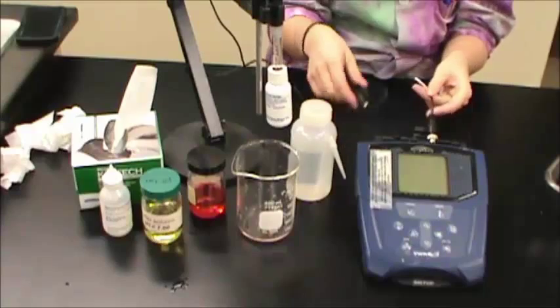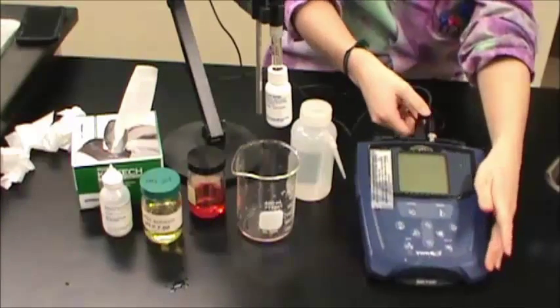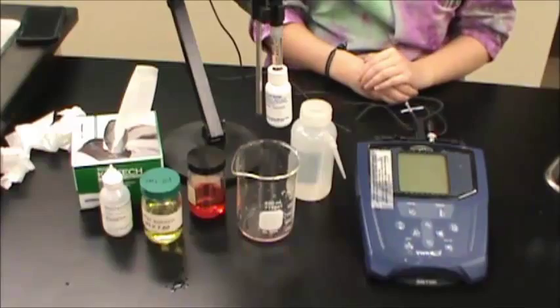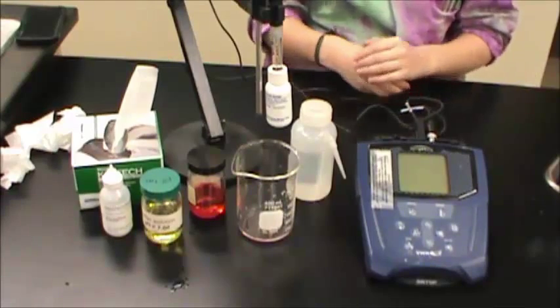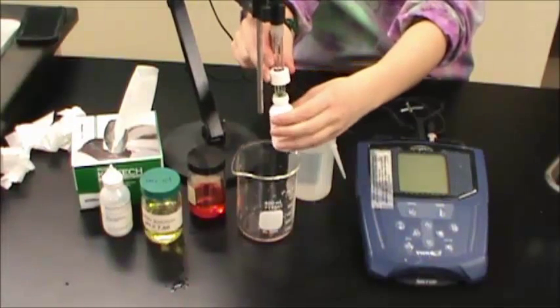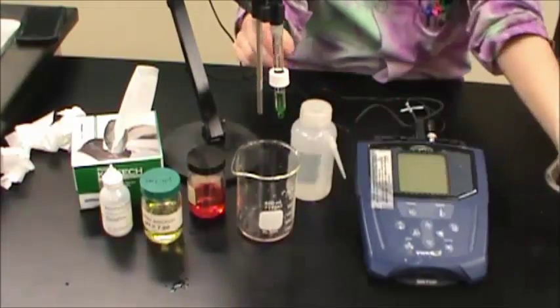Make sure that both probes are plugged into the appropriate ports of the back of the instrument. Remove the bottle of electrode storage solution from the end of the pH probe and move the clear band around the top of the probe down to uncover the vent hole.